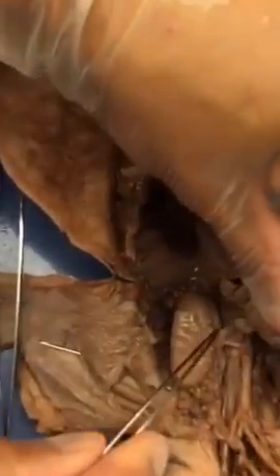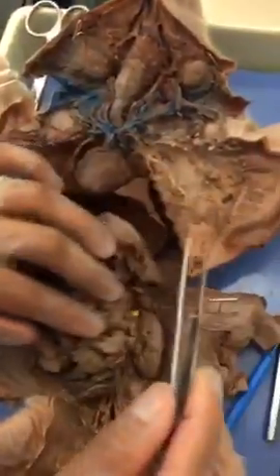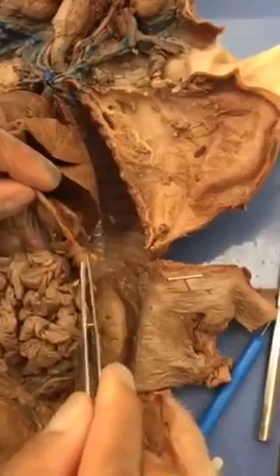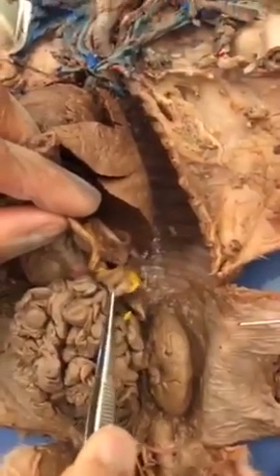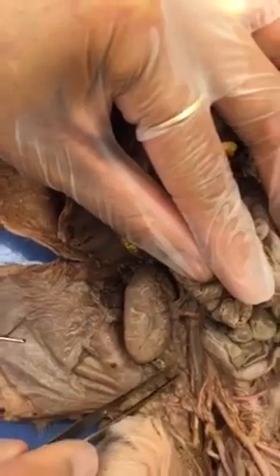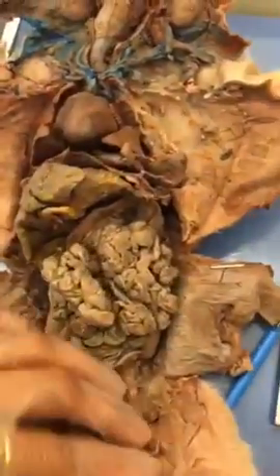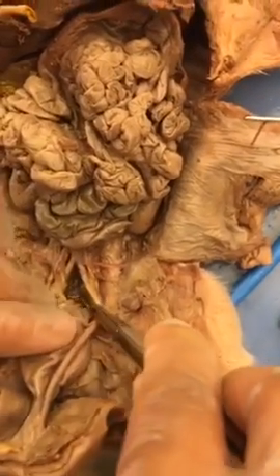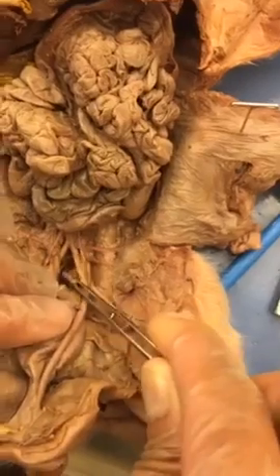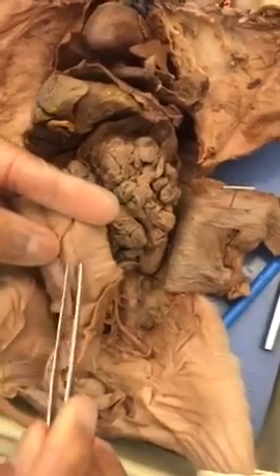Renal arteries and veins. Renal artery, renal vein. Spleen. Remember the one with the yellow on it. Kidney. Hilum is the center where the vein, arteries and the ureter come out. So these are the ureters. Urinary bladder is going to be right inside here in the hole. Urethra. Show him the hole. It's a tube inside the penis.